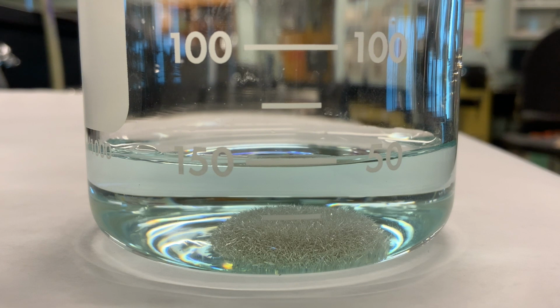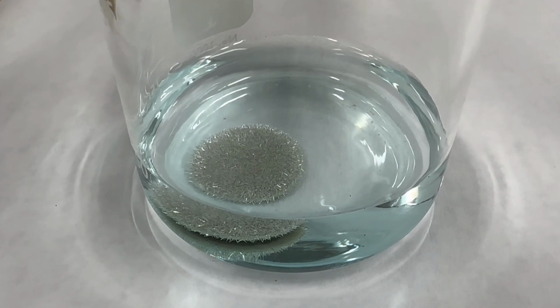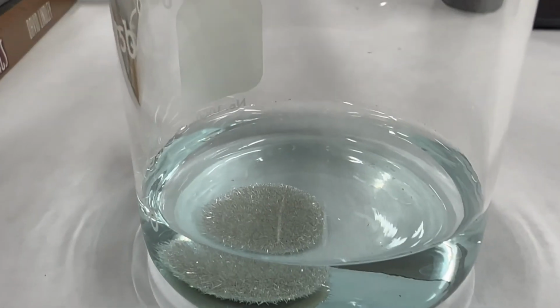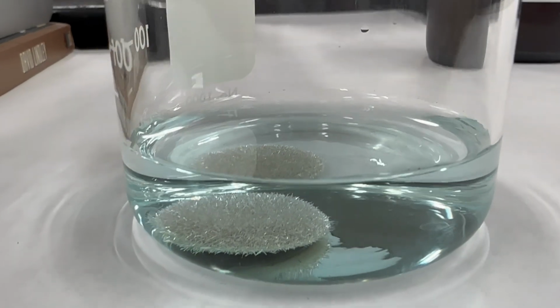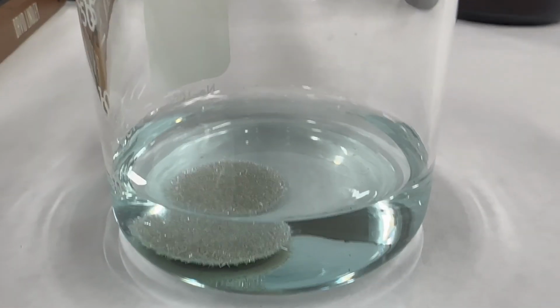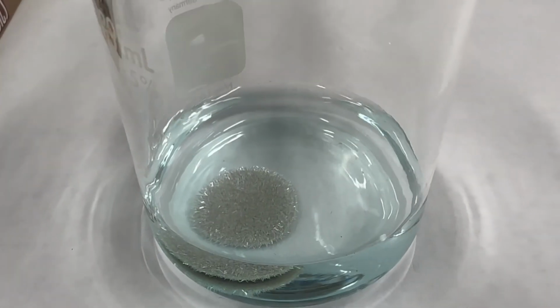Why they are crystals like this is that the silver builds up, coming out of the solution basically one atom at a time, the same way frost is formed, one H2O molecule at a time, and it builds on itself in these sort of hairy filaments. I also want you to note the color of the solution. It's gone from a clear liquid to a blue color, which indicates that the copper from the penny has displaced the silver and now is in solution along with the nitrate.